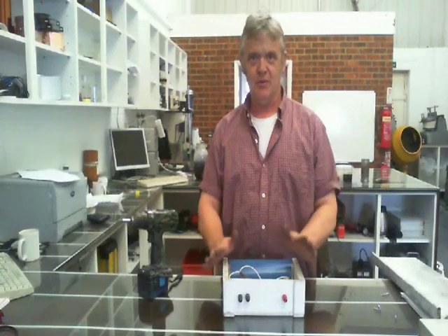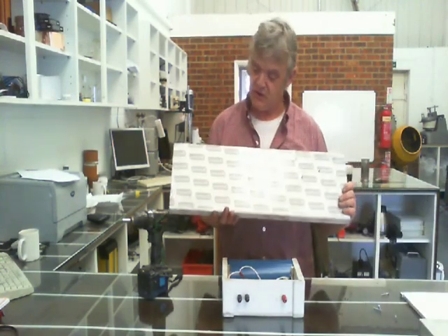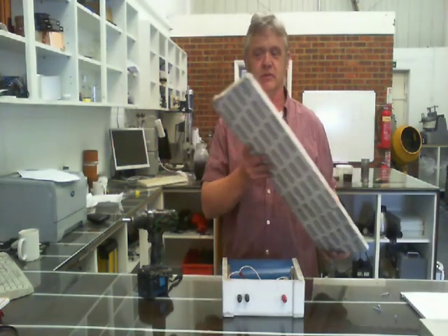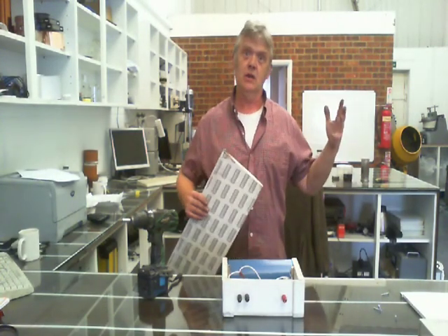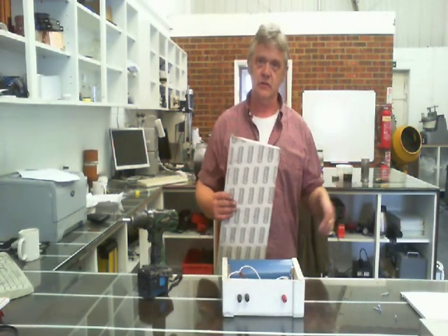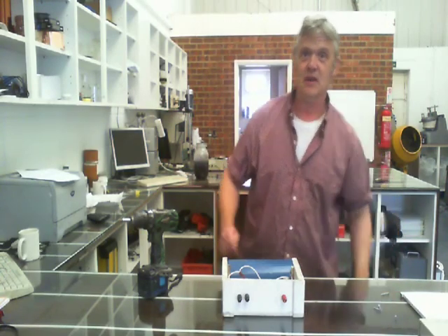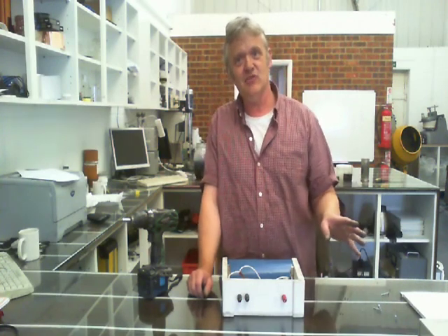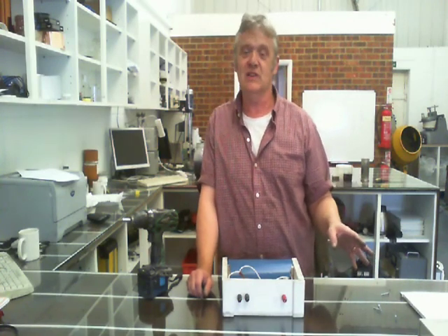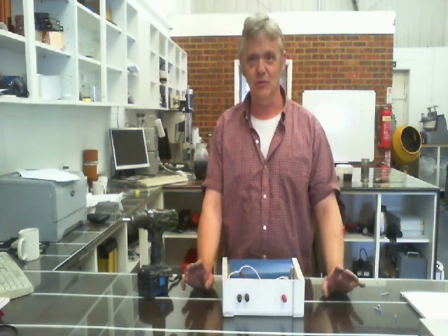So here's the lamp unit made. Now, before I show you how I made it, what I used to make it was this stuff. Now, I've gone on about this before. This is called builder's board. It's a PVC clad polyurethane foam, and you buy it in a whole range of widths and lengths, and usually about £25 for a 5 metre length, but you can make loads of things out of it. And the good thing about it is you can saw it really easily, it cuts with a carpet knife really easily, sands beautifully, so it's really excellent stuff to work with.